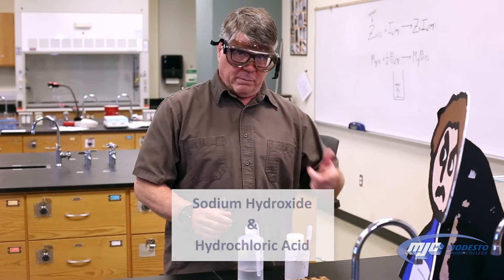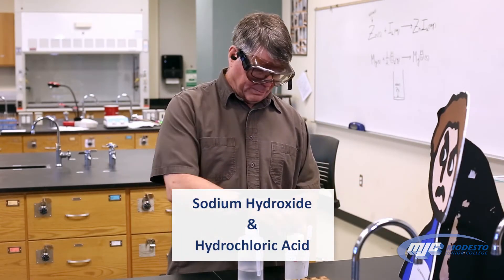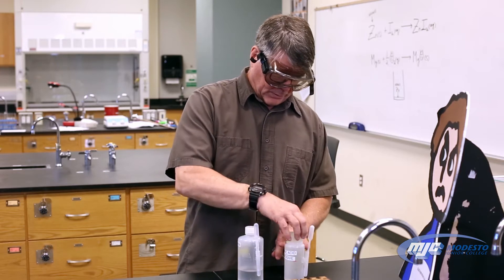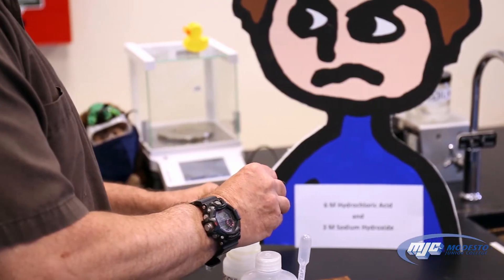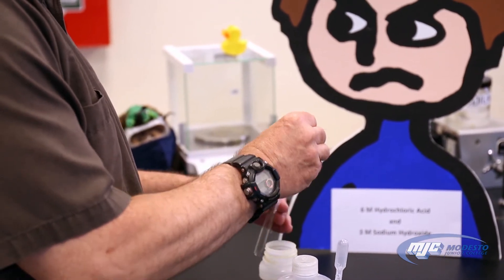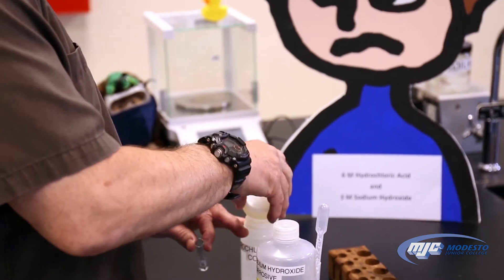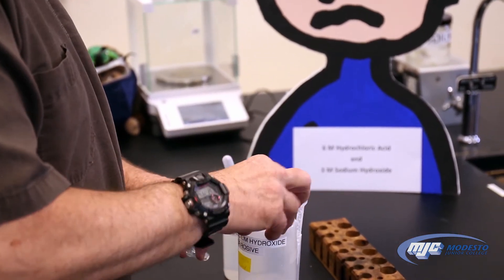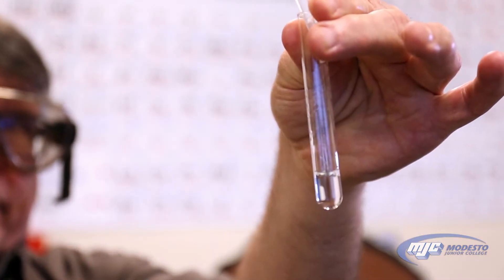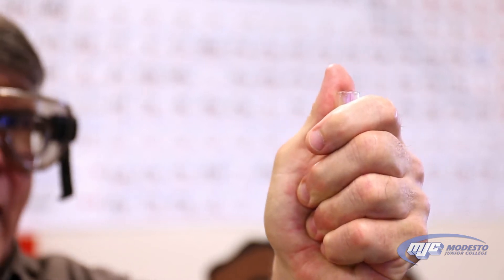This is the reaction, if any, between hydrochloric acid and sodium hydroxide. As always, put the lids back on the containers. Whoa, that's getting hot.